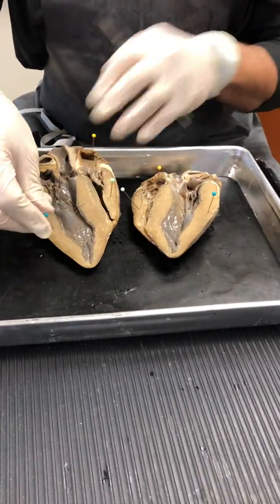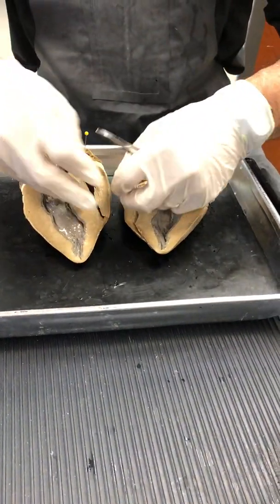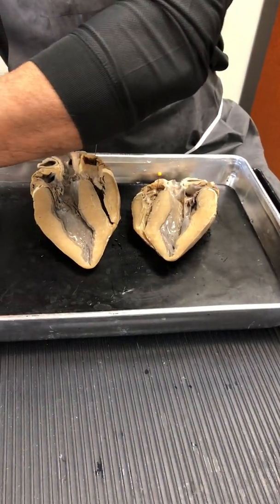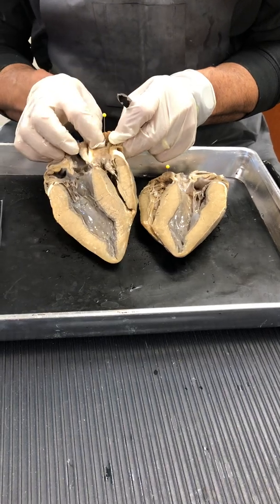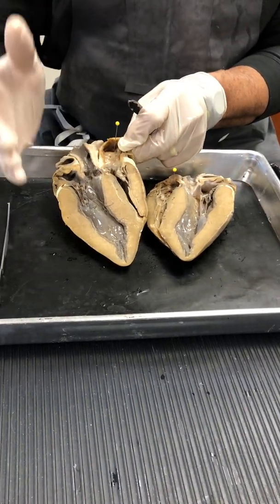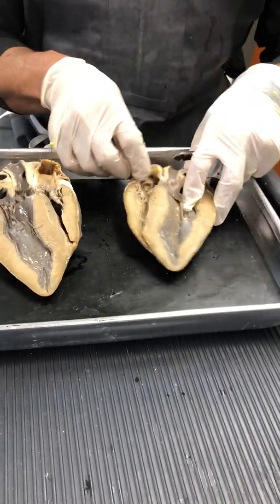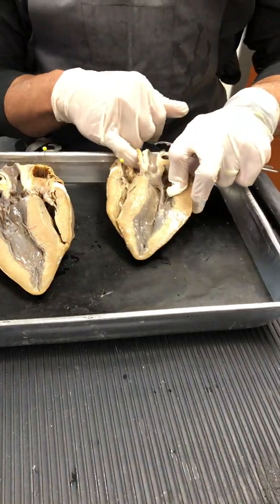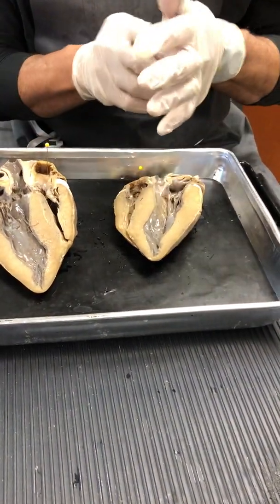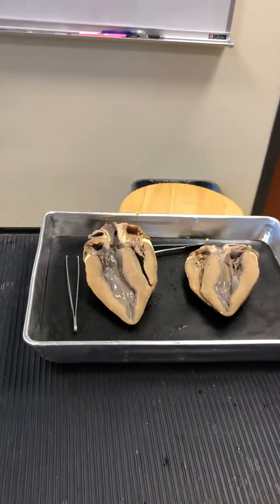Okay, so let me take these pins out now. So now there's the right atrium. So now I'm going to feel in there, folks, because what I'm looking for now are the blood vessels of the right atrium. So there's nothing there on that side. So I come over here, and there I see there's the superior vena cava, etc. All right. So now what happens? Okay, now the other thing too, lots of skewers are available to you.